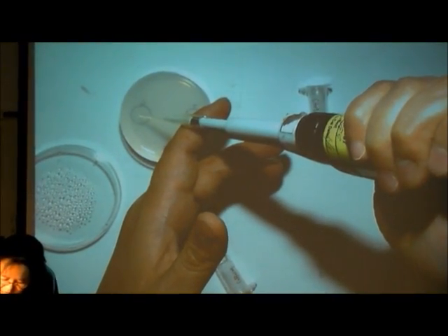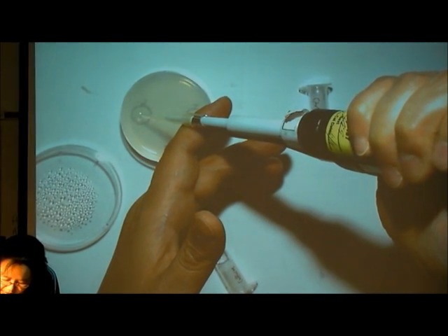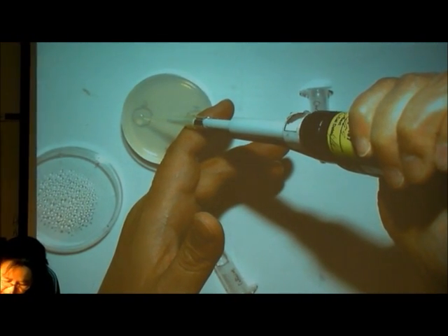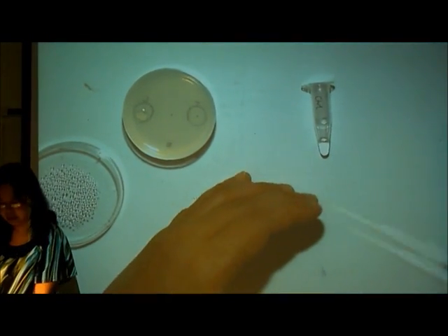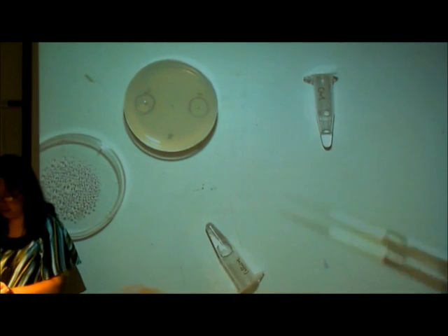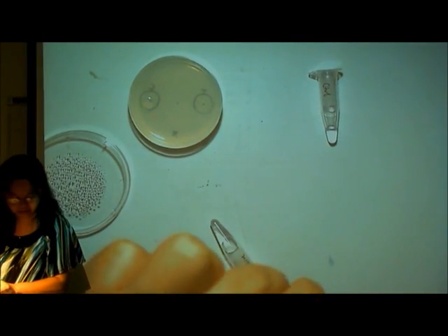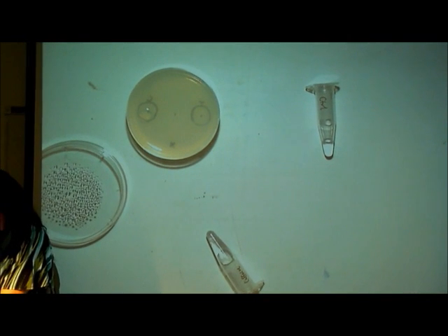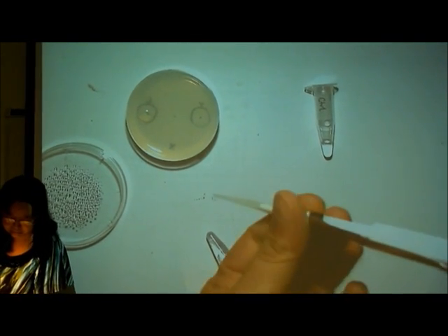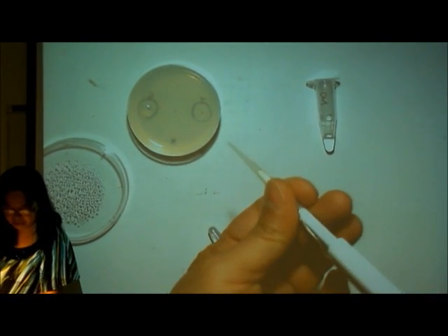Slowly, on the dead center of the spot, and very slowly, put your liquid on your plate. Remember to change tips each time that you change the chemical or put your animals on it.